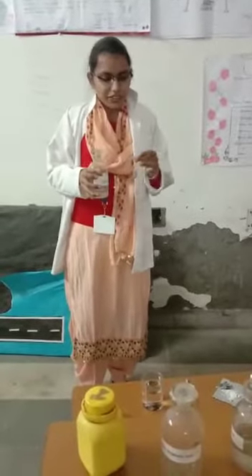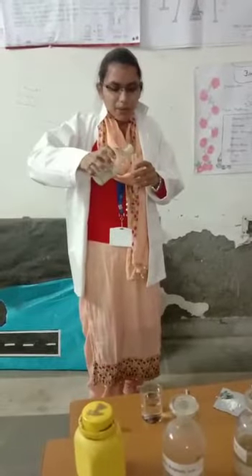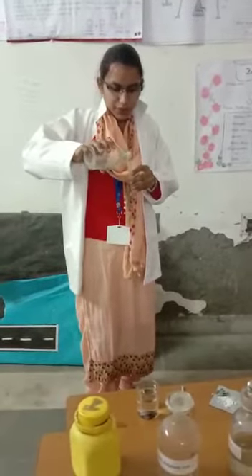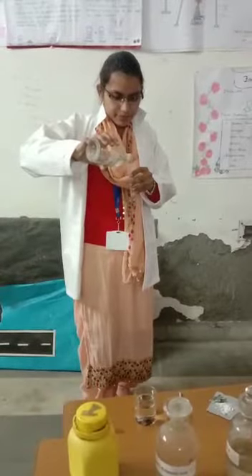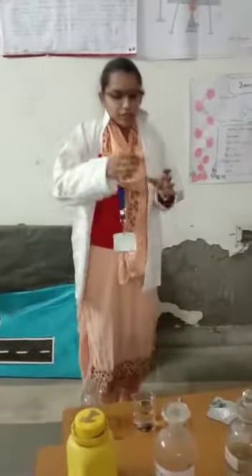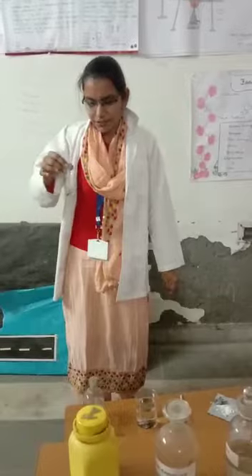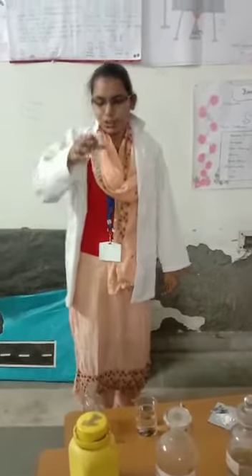Now we take calcium sulfate and add ammonium oxalate in the test tube. White precipitate is not found initially. Now we wait 2 to 3 minutes and shake. After 2 to 3 minutes, we get a white precipitate in the test tube.